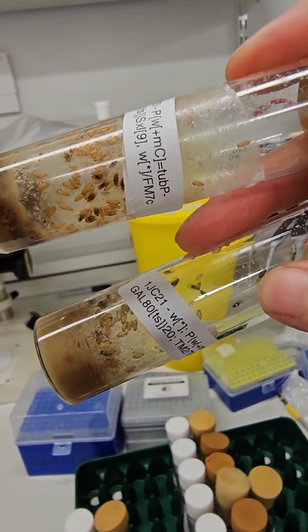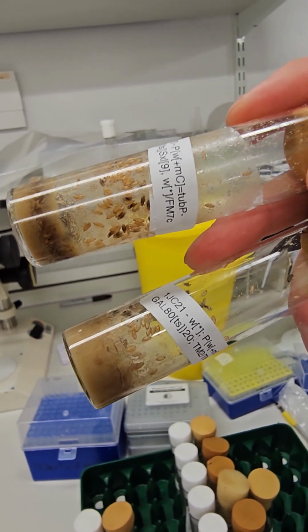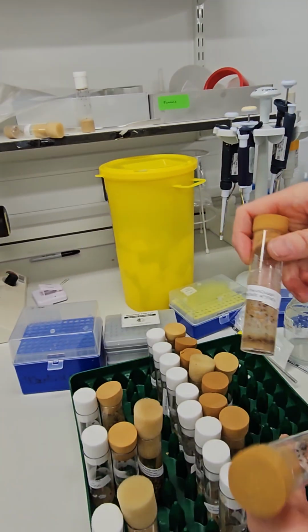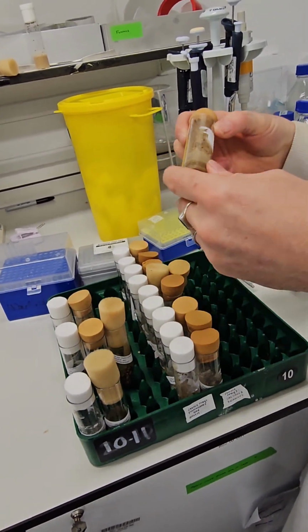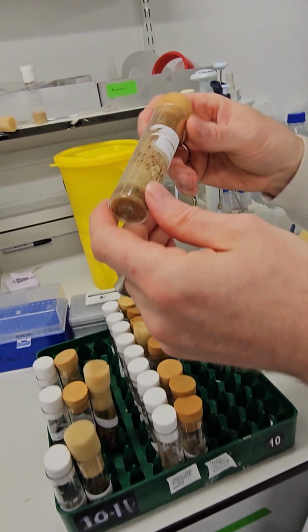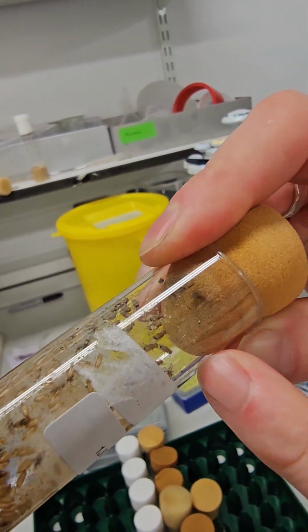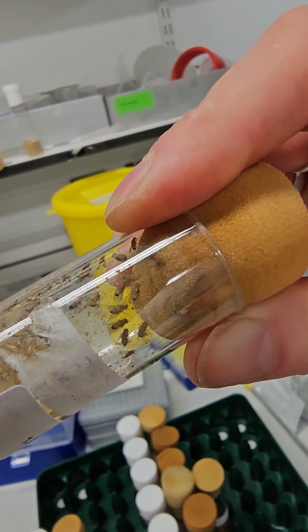So this is a particular marker called tubby. So the larvae are shorter and fatter, and the flies are shorter and fatter than their wild type counterparts. Okay. We have various other ones. So that one's, let's get that round the right way. That was in there. We have others. So these ones are curly. They have little curly wings rather than straight wings. So again, we can see there, little raised curly wings. So we can tell the difference between them.